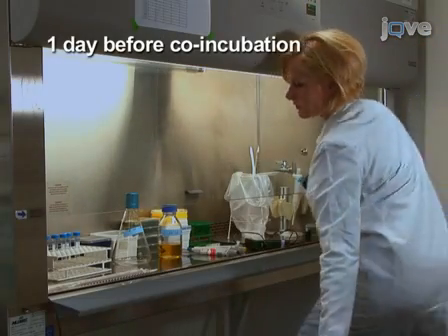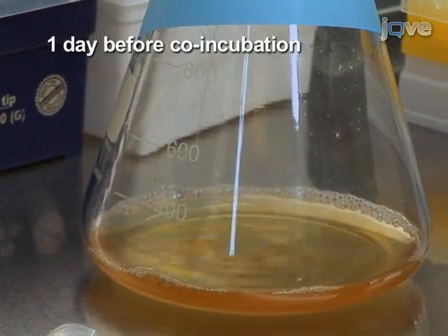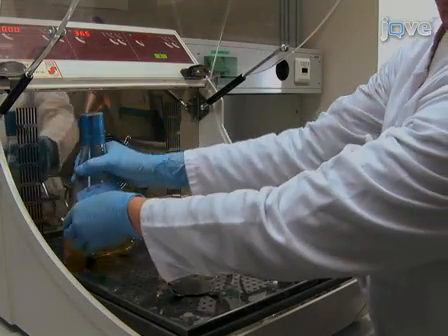To begin this procedure, grow a culture of E. coli bacteria transformed with the shRNA expressing TRIP vector with an overnight culture as described in the accompanying written protocol.